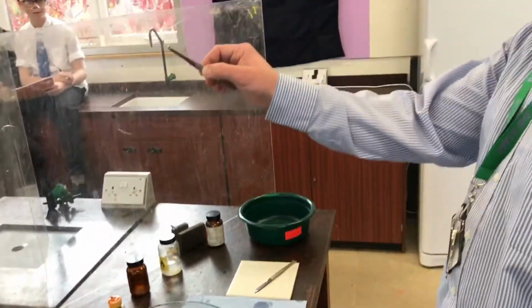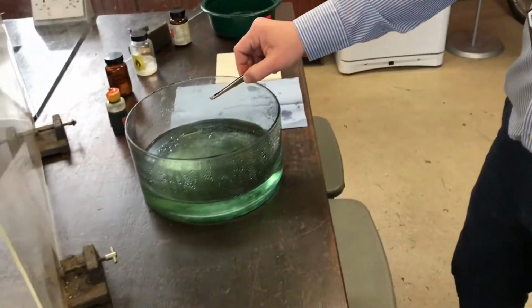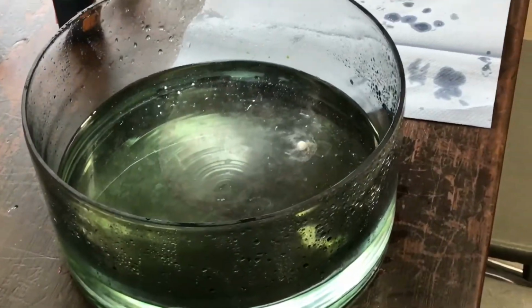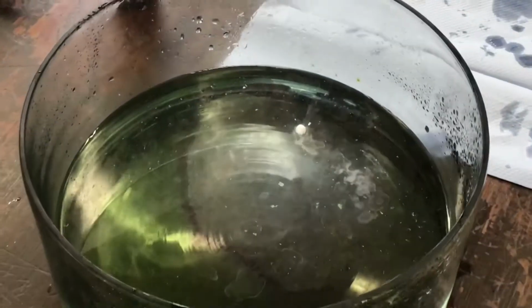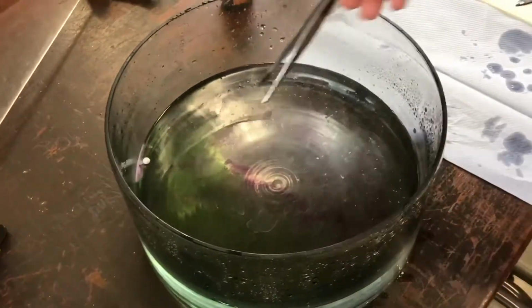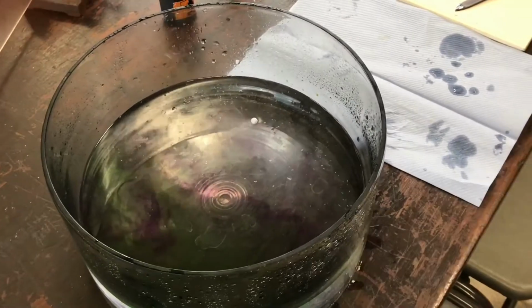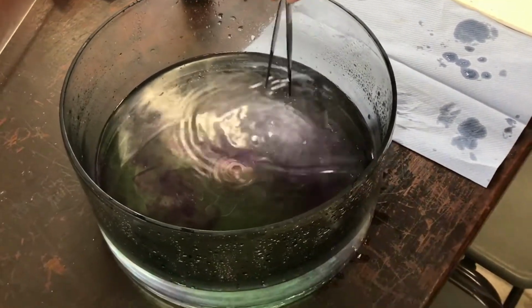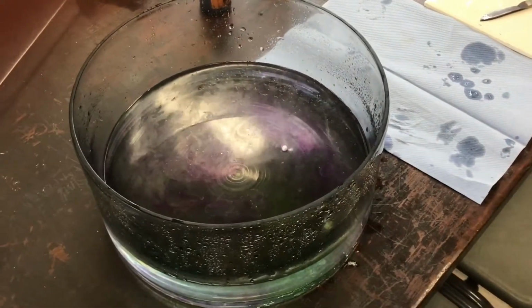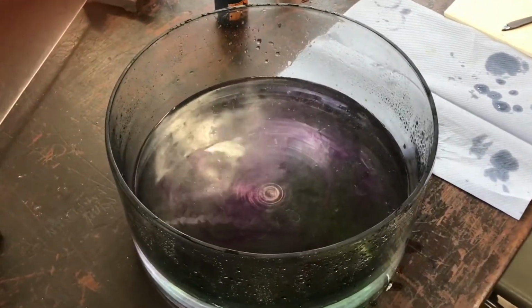Okay, and we're going to react it with water now. So can I have a 3? 3, 2, 1. Now we're getting more of a reaction, and it's actually turning itself into a ball, a pea. Lots of heat, lots of alkali indicator being shown here. Very quick reaction, lots of gas. I can even sort of get a whiff of that, and tons of heat.